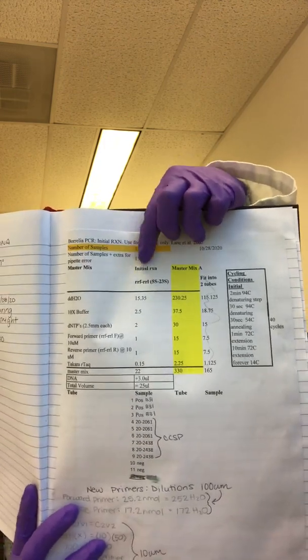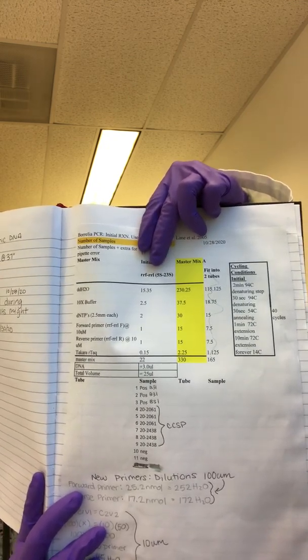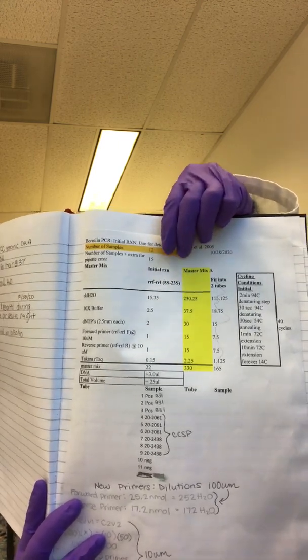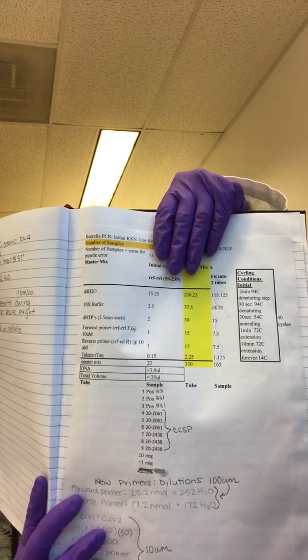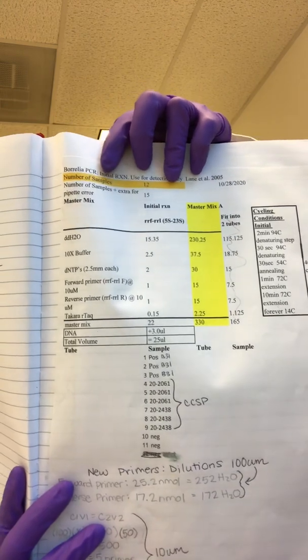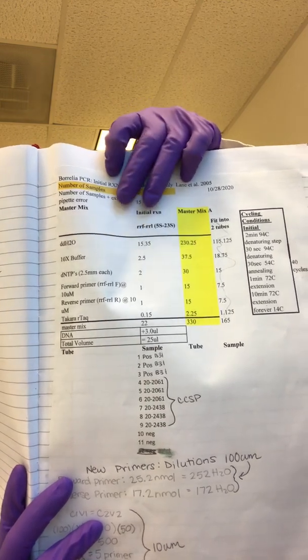This autofills down here for our PCR error or pipette error. And everything else should autofill as well. I still like to double check these equations, or at least eyeball them over, because sometimes the equation gets messed up on your Excel spreadsheet, which will mess up your master mix, which messes up your PCR. And you won't find that out till the end, so just make sure that this is all correct. Also make sure you're using the right template for the right stage that you're on. You can see up here, this is your initial PCR template, so don't use your initial PCR template on a nested because the quantities are different.